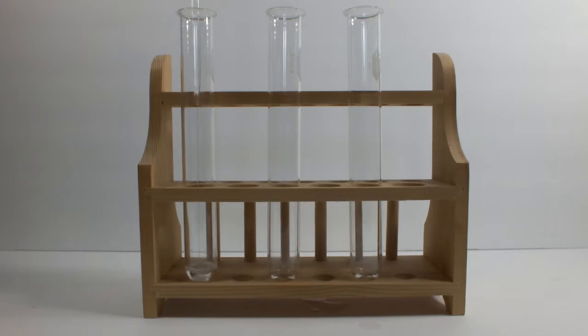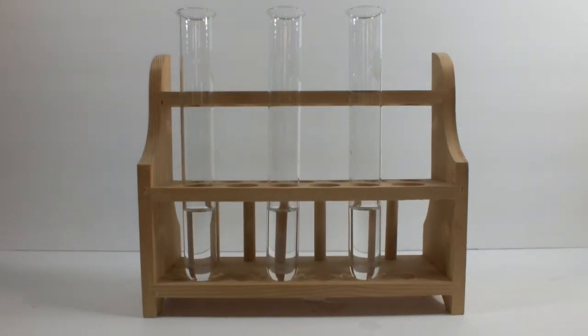So let's get back to that 0.5 molar solution I made, and a procedure I know will work. Here are three large test tubes, and I'm going to add 20 milliliters of the 0.5 molar potassium phosphate solution to each, with a volumetric pipette. It's a rather slow process, but at the end of it, each test tube will contain 0.01 moles of dibasic potassium phosphate. Here we go, all filled up.